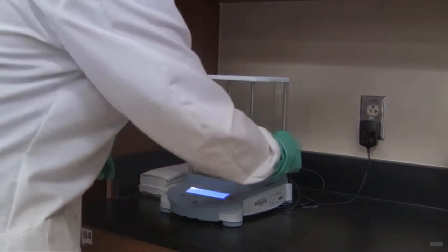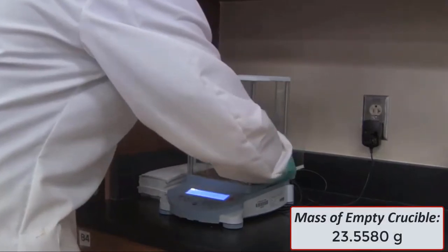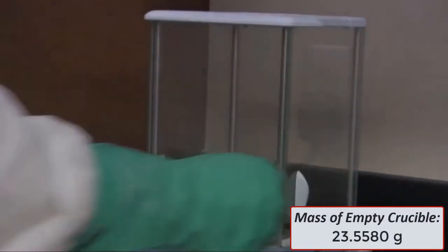I'm weighing it on an analytical balance, which means I'm weighing it to 0.0001 gram.